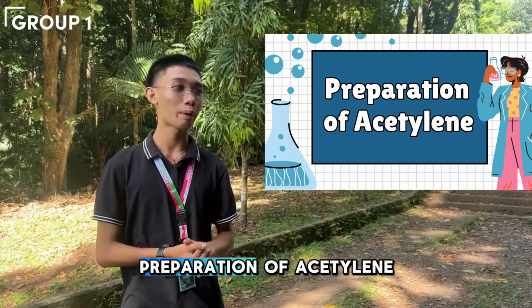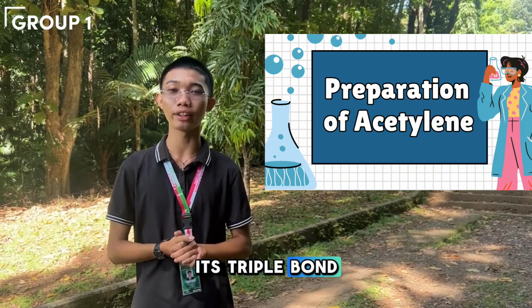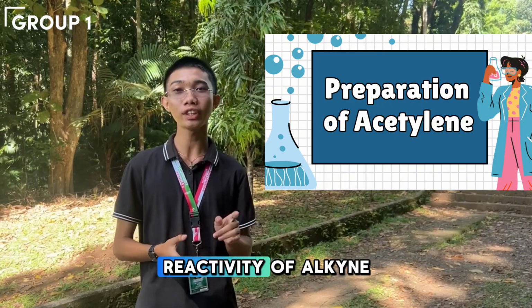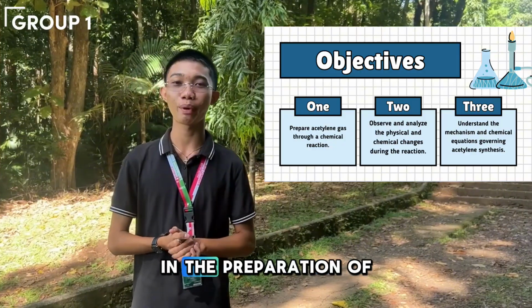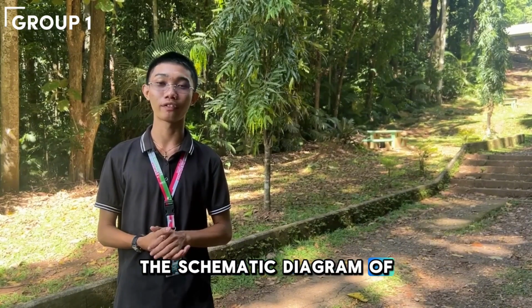I will discuss the preparation of acetylene, a hydrocarbon characterized by its triple bond, making it an alkyne. This process highlights the reactivity of alkynes and their generation in the lab. So these are the objectives for my discussion on the preparation of acetylene. So moving on to the schematic diagram of the procedure.